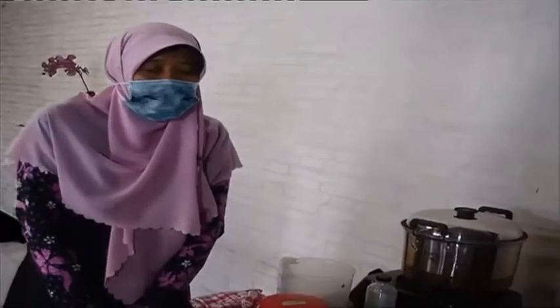Okay, I come back to this session and meet Lutfi again. And the second method, I will continue to the second method for propagation or mass production of plant growth promoting bacteria.